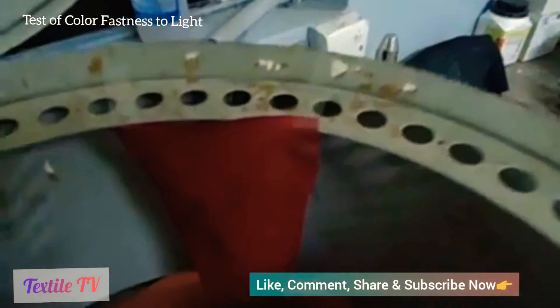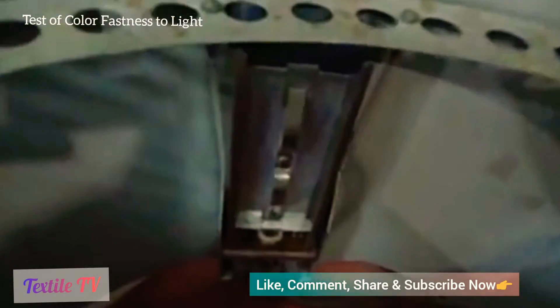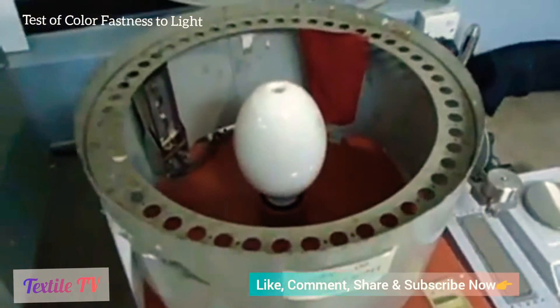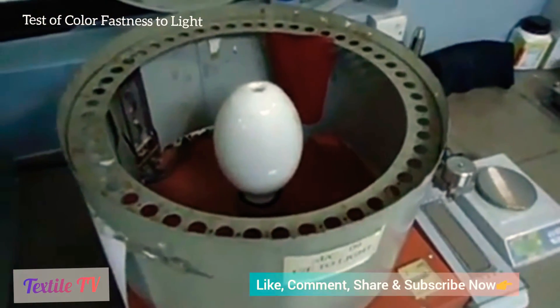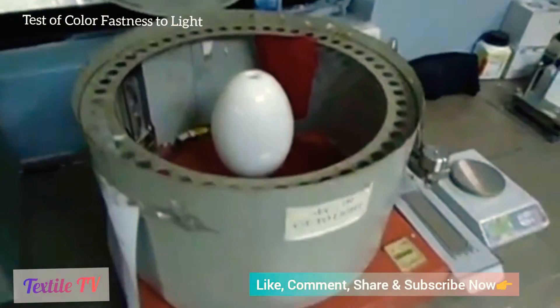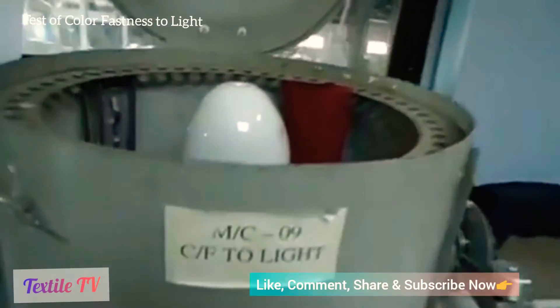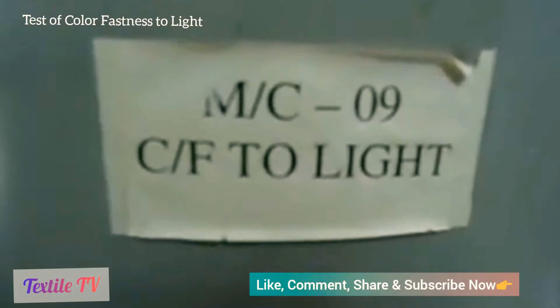In this video, I am going to discuss color fastness to light and show you how to test fabric color fastness to light. Color fastness to light is important for textile and apparel products.